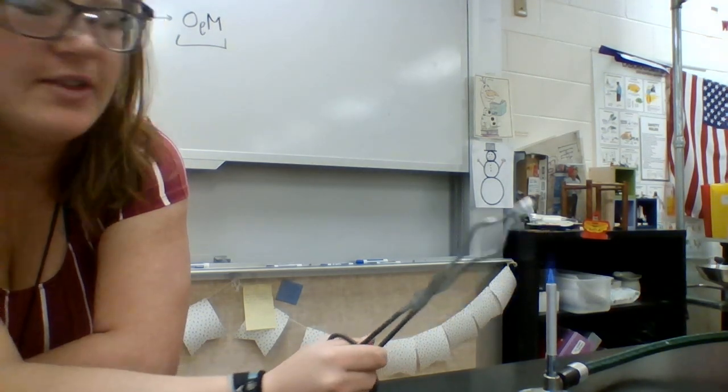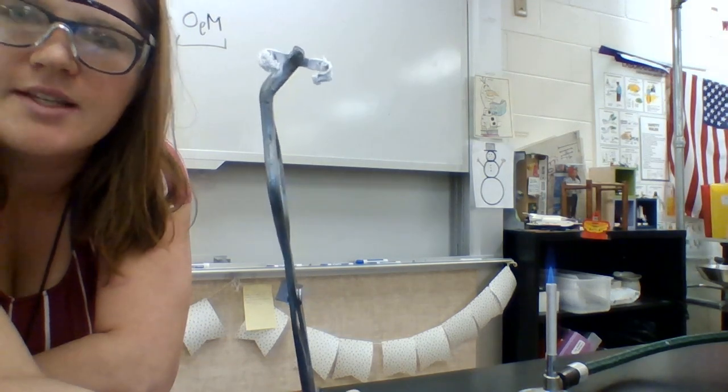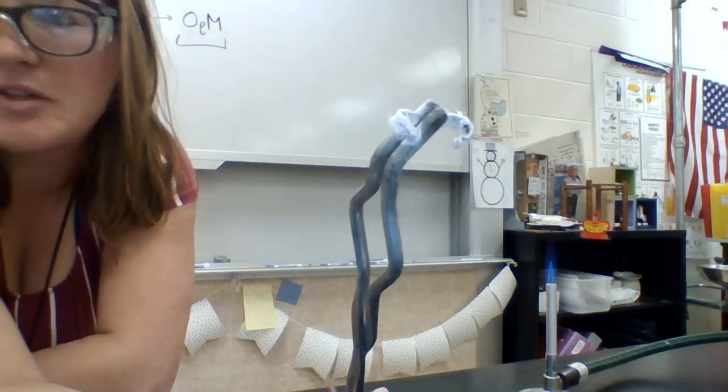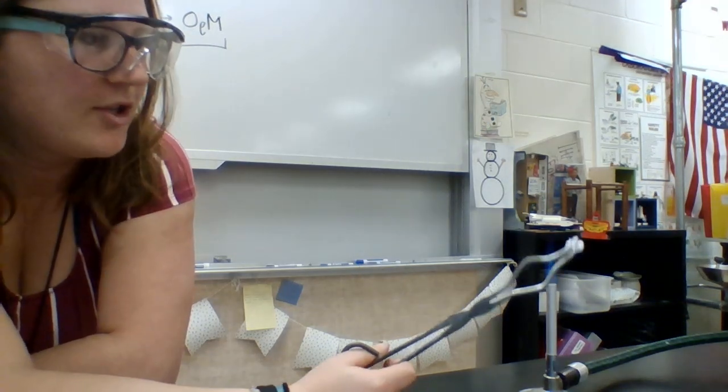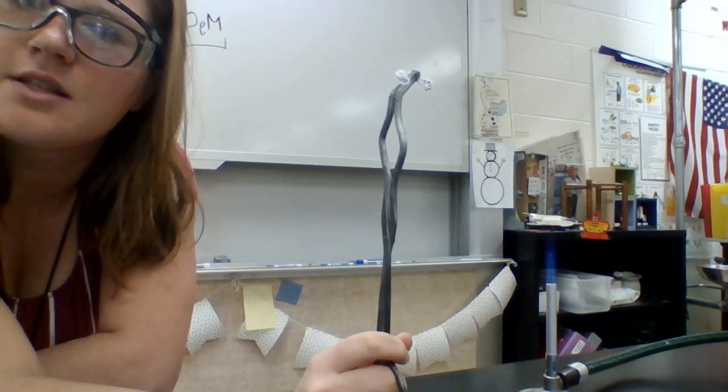So what you'll do is write down the evidence of that reaction. You can see that white powdery stuff. That's that magnesium oxide that forms. So that white powder on the outside of this metal, that's magnesium oxide. That's what it looks like. We created that by just catalyzing the reaction of magnesium with the oxygen in our atmosphere. So this is a synthesis reaction.